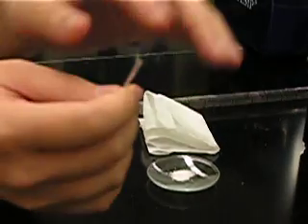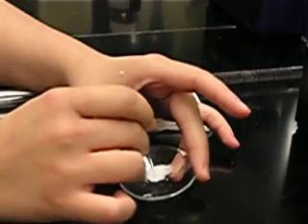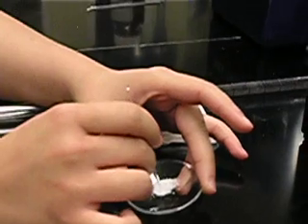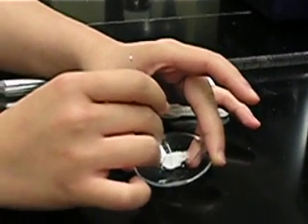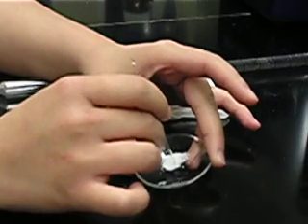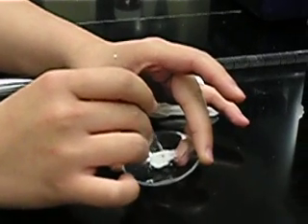Now you want to take the open end of the capillary tube and tap it gently on the sample. You don't want to tap it too hard because if you do so, the sample will not fall down to the bottom of the tube. And if your sample is not dry, it will not fall down to the bottom of the tube either.